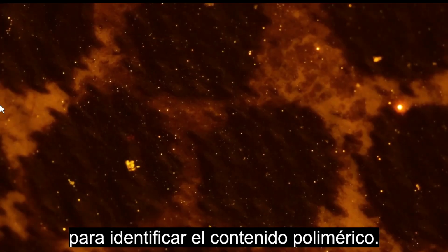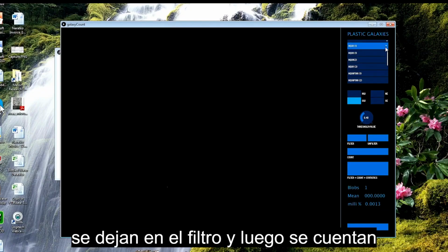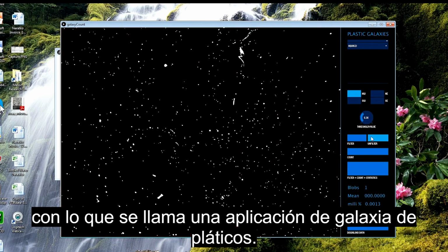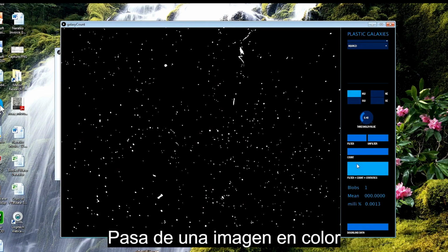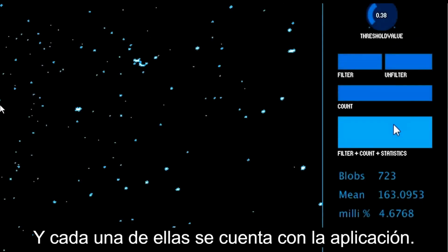Smaller particles that are fluorescing are left on the filter, and those are later counted with what is called a plastic galaxy app. Each quadrant is read into the app. It's turned from a colored picture into a black and white, where the fluorescing plastic particles are white relative to the dark black background, and each one of those is then counted with the app.